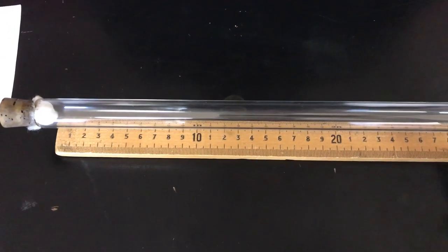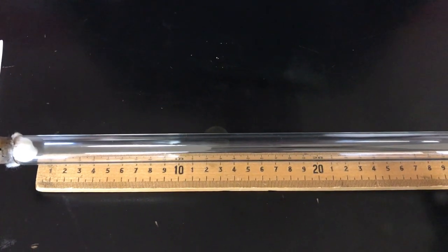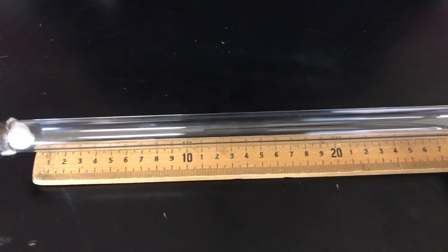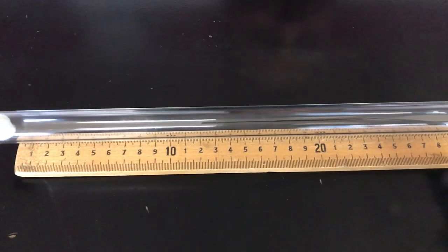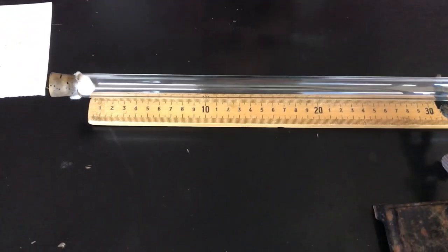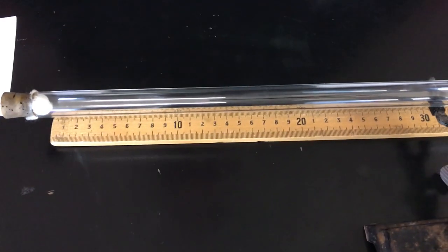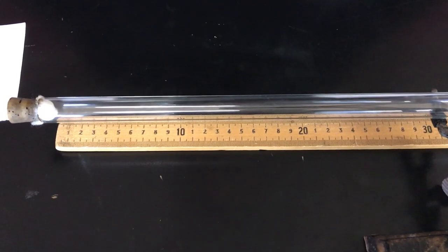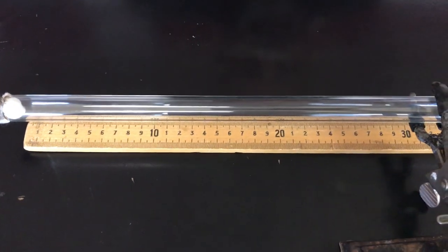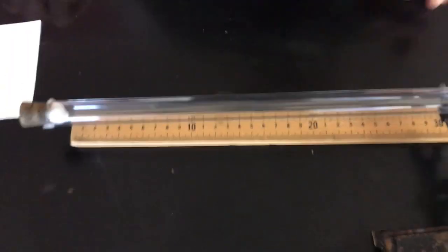It does show up. It just depends on how patient you are. Oh, Mr. Moore, I think I see it. I just bumped it. That's okay. No problem. Yep. I see it too. Right there.